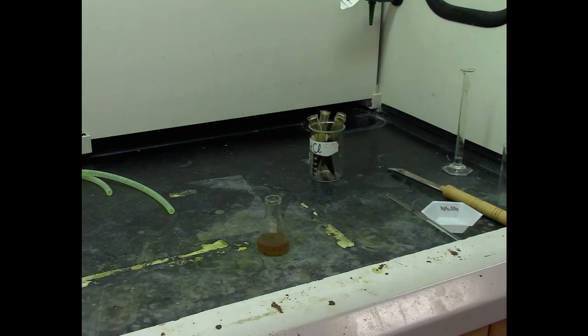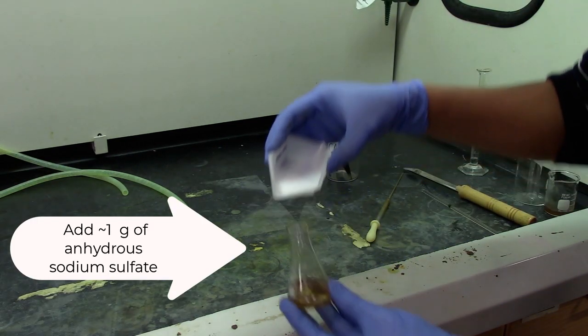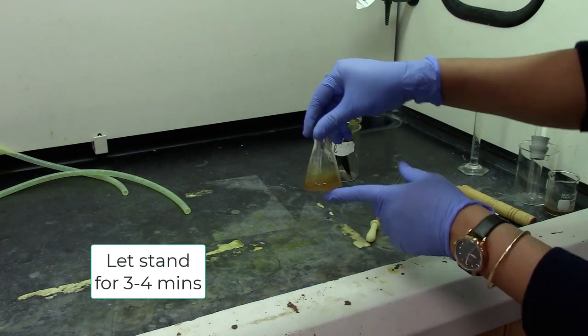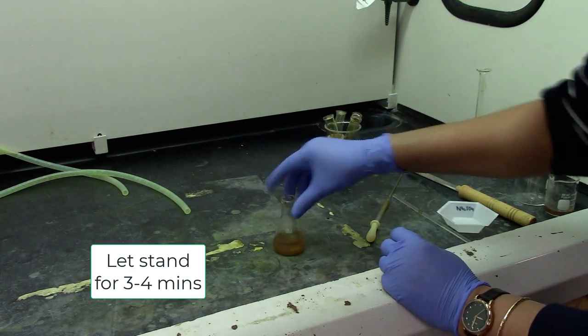Once you have collected all the bottom layer, add about 1 gram of sodium sulfate which is the drying agent and let it stand for 3 to 4 minutes.